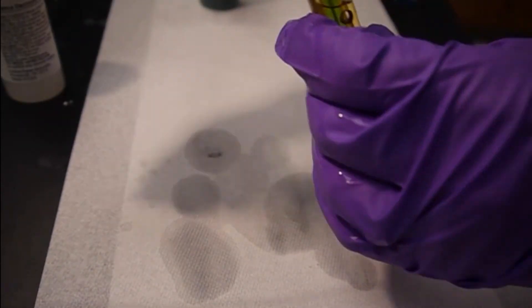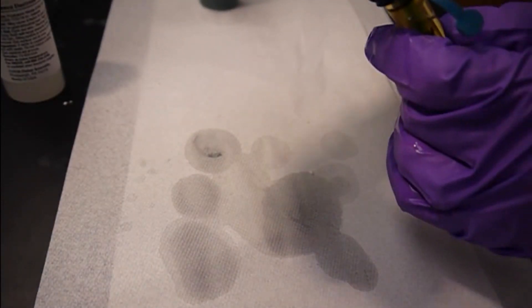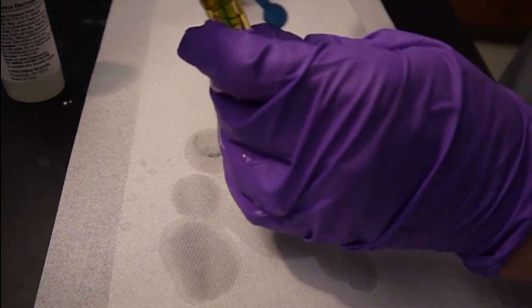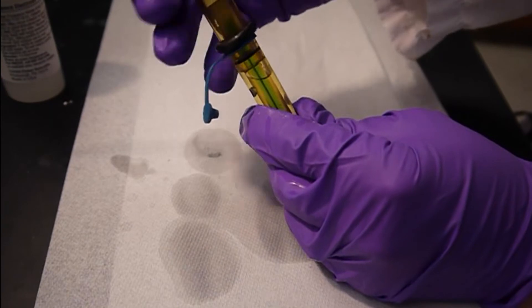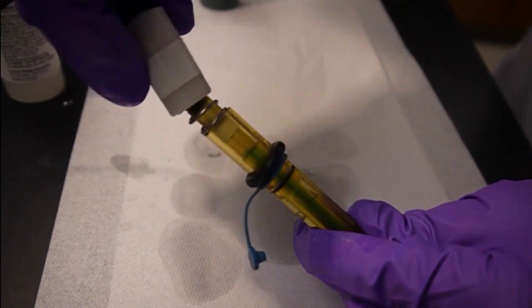And then put the cap back on. And then this is ready to go.